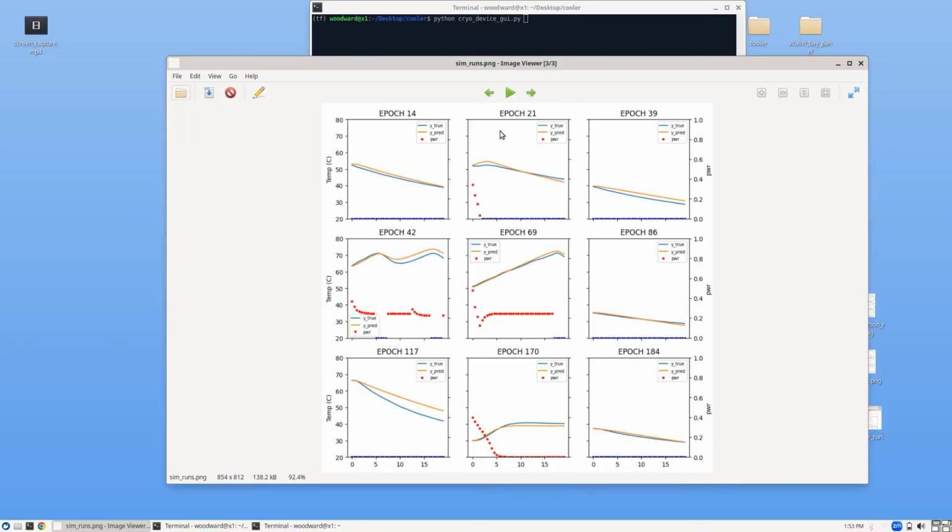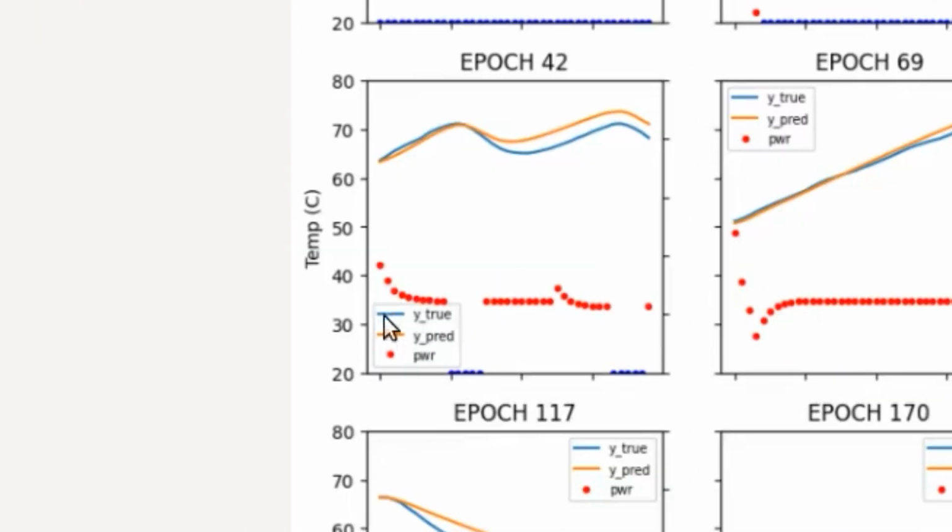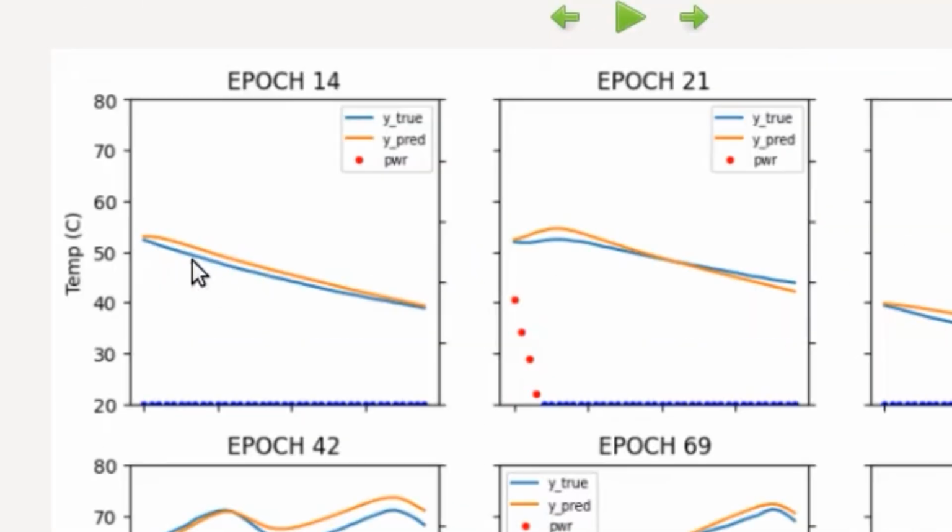So down below are the controls. This is when heat was applied. This is when it was plunged in. The purple or whatever blue down there is when it was plunged. And then the actual lines here are the temperature curves. The blue line is what was actually measured during the data collection, and the orange line is the predicted.